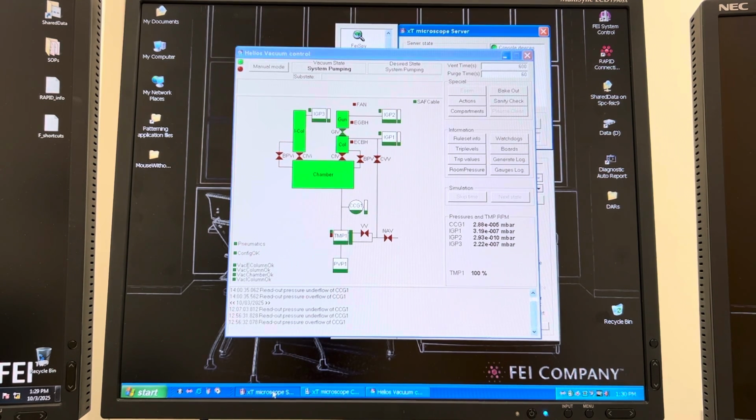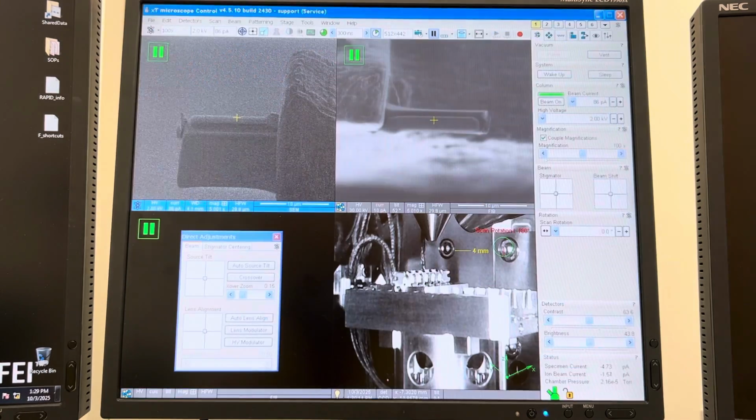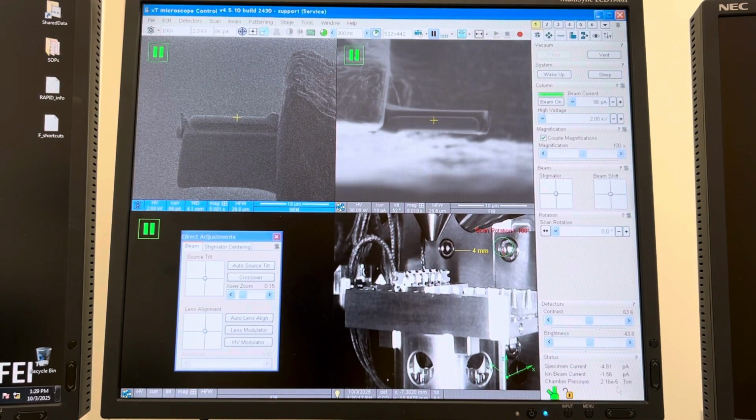Okay, so on this system, from experience, what I know is that we should be able to get this chamber pressure, because normally I like to deal in torr. That's what most people deal with. It is not millibar but torr. They're not that different. The equivalency in millibar is a little bit higher, but ultimately we can get this into the high E-7 torr range. If the chamber was already under vacuum when I came in and loaded the samples and then pumped it back down, I should have been able to get this easily into the mid E-6 torr range within just a few minutes.